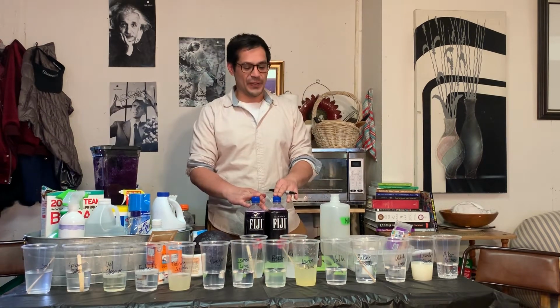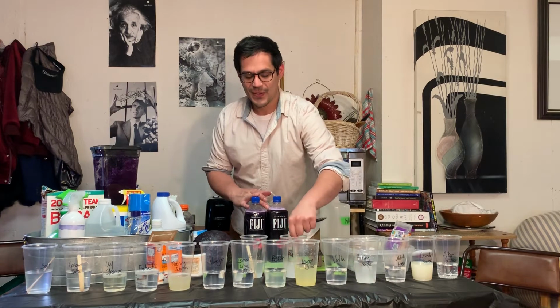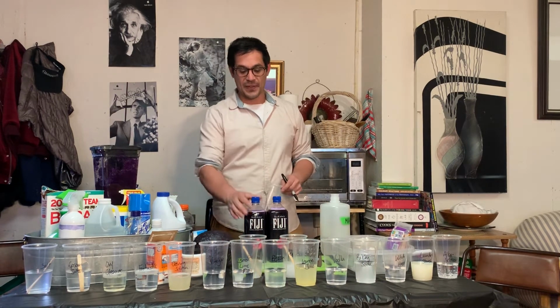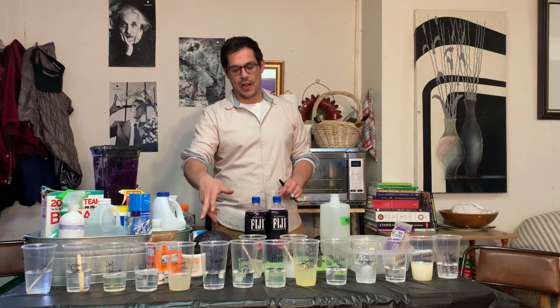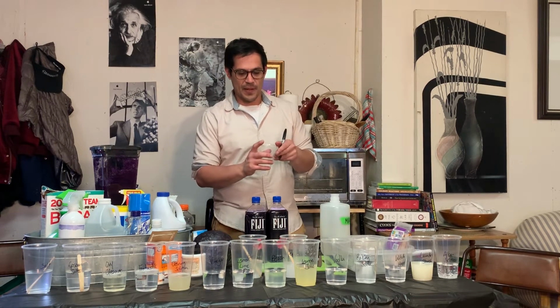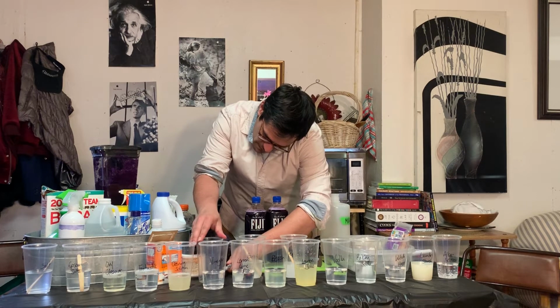Once you've prepared all your solutions, or are still waiting for your other solids to dissolve, we can start with the addition of the solutions that are prepared. With the indicator that you made, we're going to put a set amount into each of these. So what I'll do is I'll do half the volume that we have in our indicator cup. So I'm going to put that there, mark off about half.